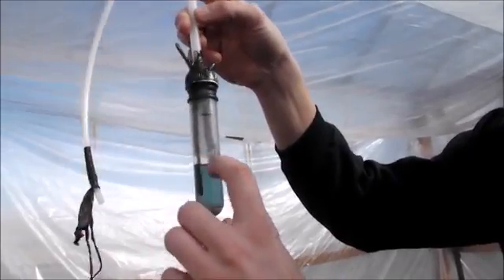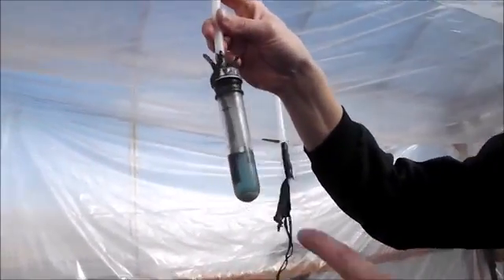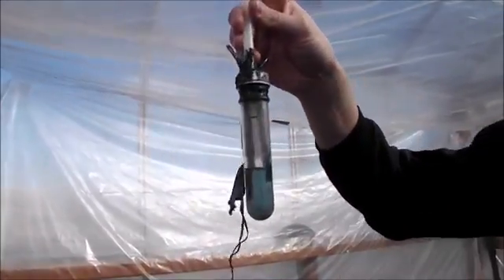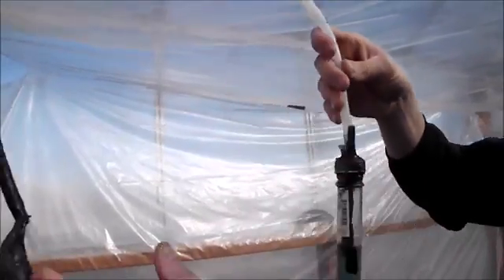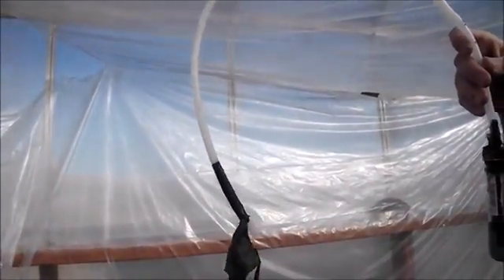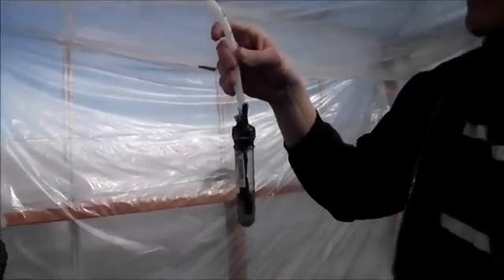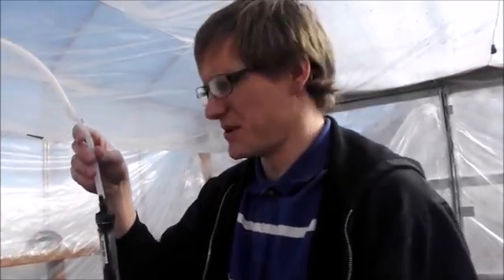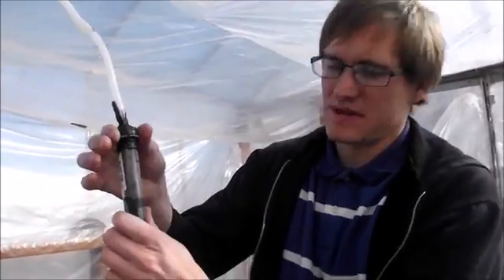That's about all I can do because the electrode didn't go all the way to the bottom of the jar. I did collect the hydrogen off this and I'm keeping it inside of a big bag. I haven't figured out how to turn it into water without causing an explosion yet, so maybe I won't even work on that in this set of experiments.